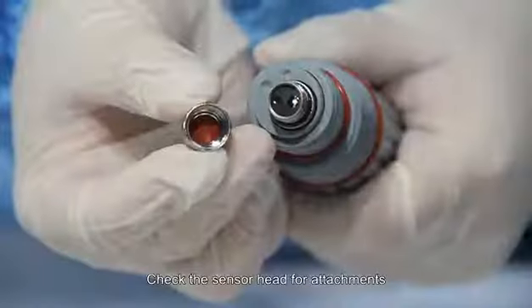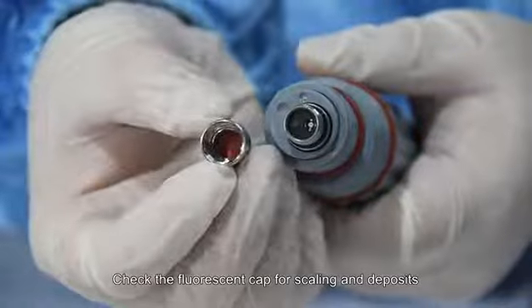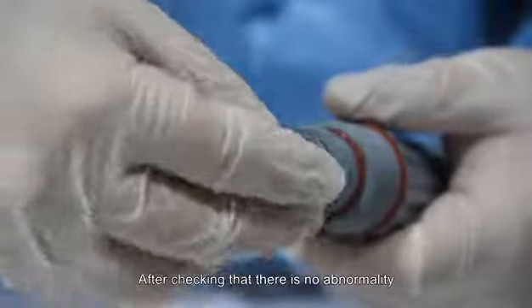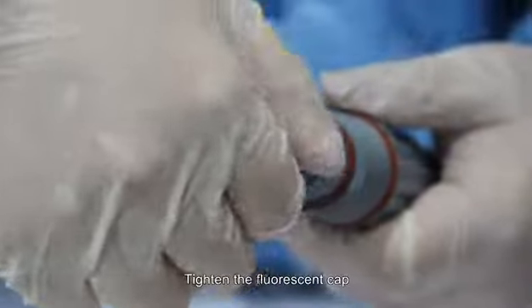Check the sensor head for attachments. Check the fluorescent cap for scaling and deposits. After checking that there is no abnormality, tighten the fluorescent cap.